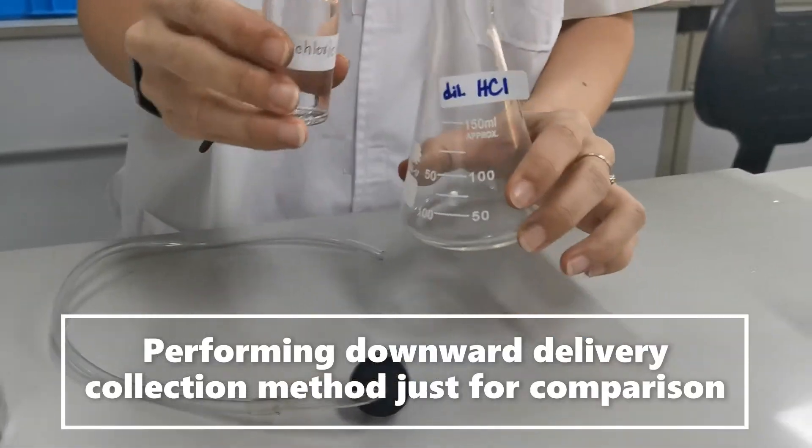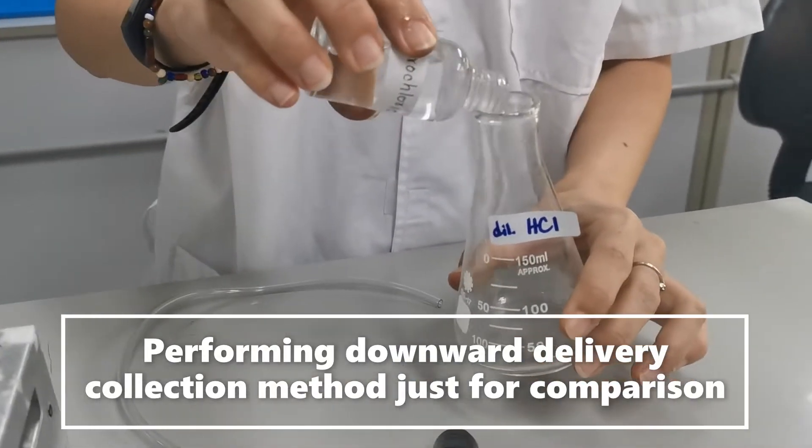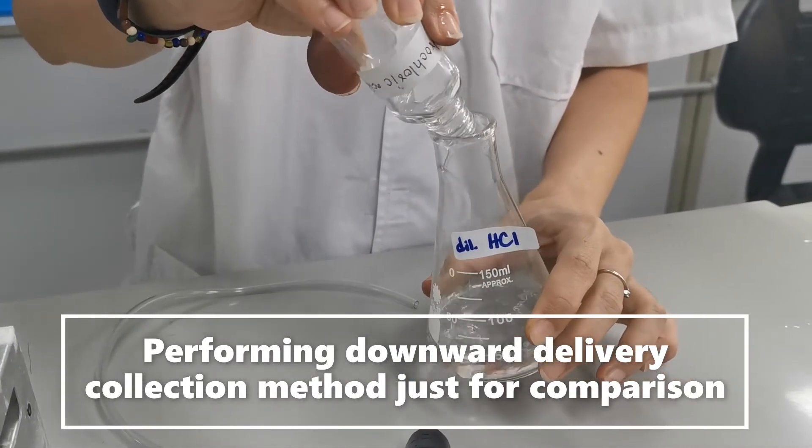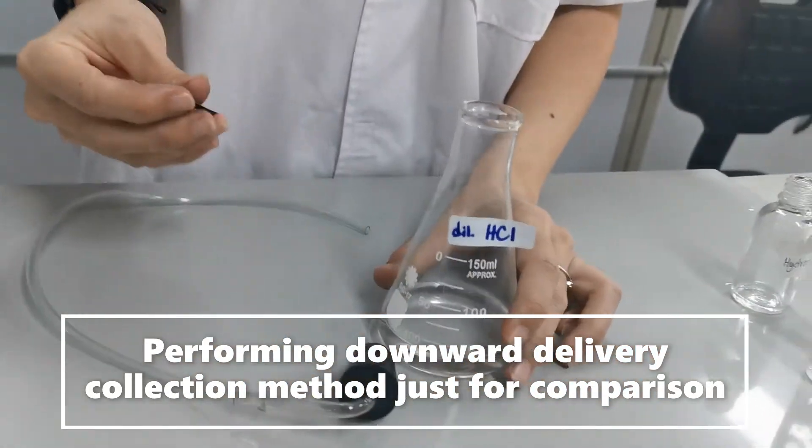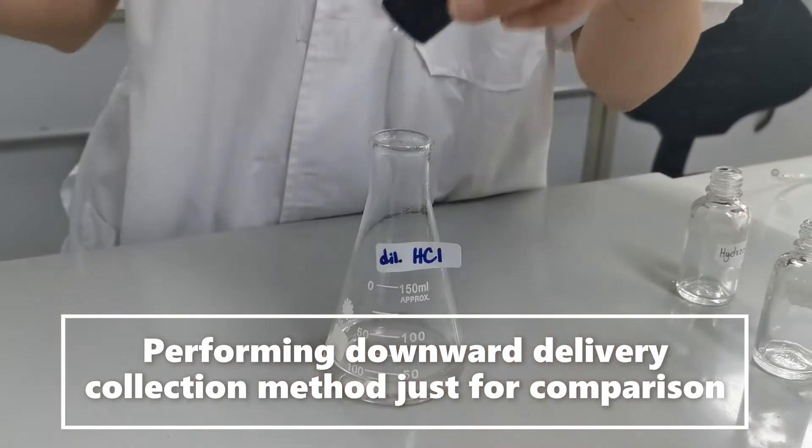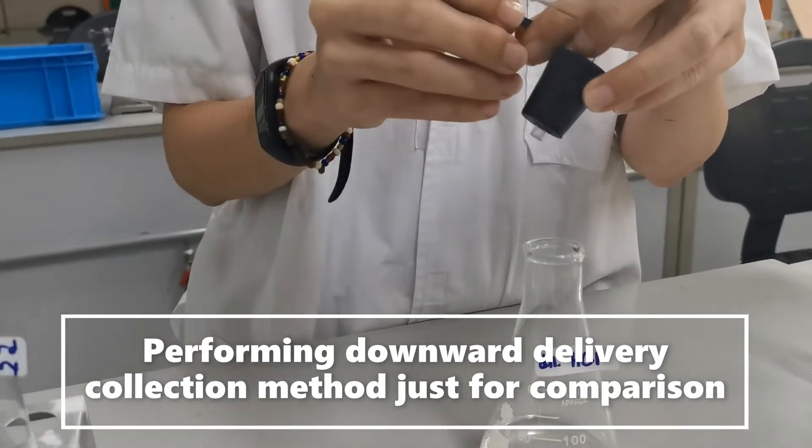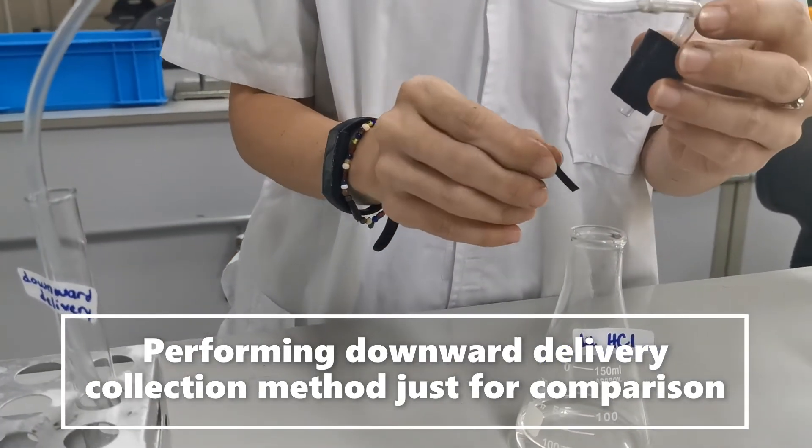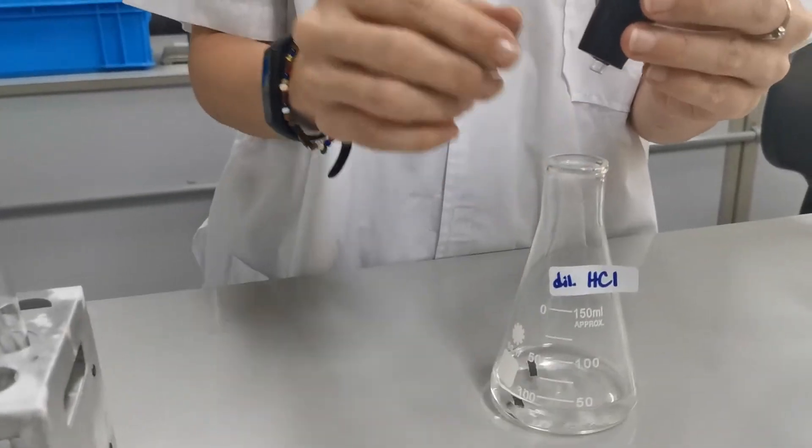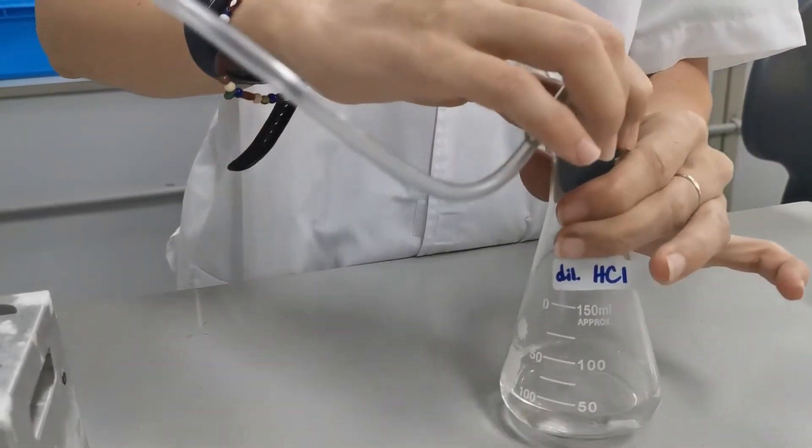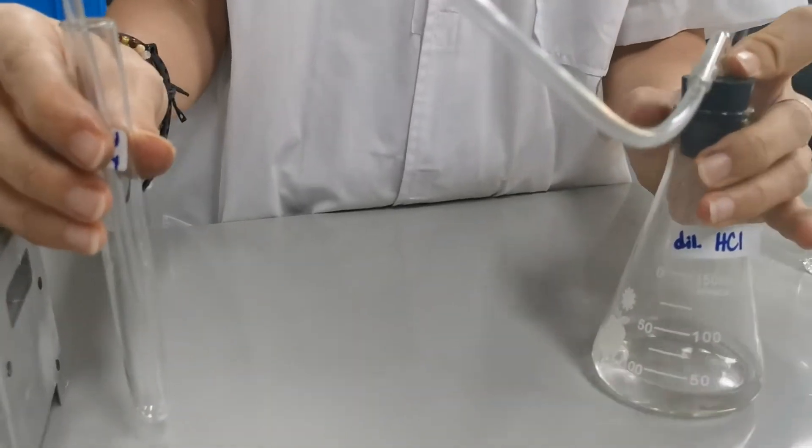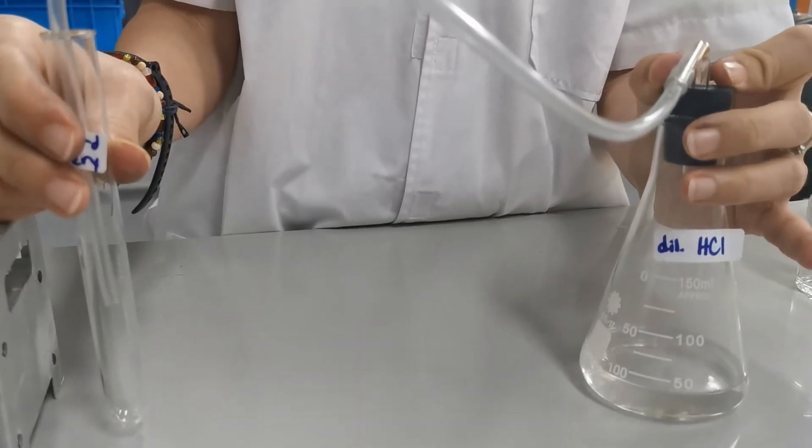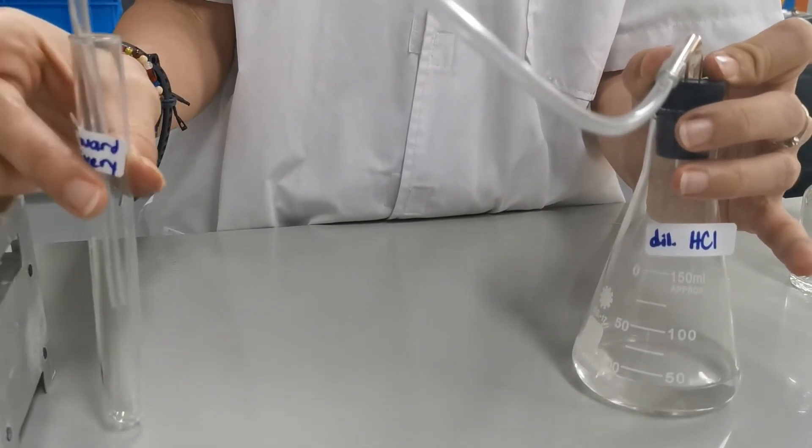I'm going to repeat the same reaction but this time let's collect the gas using downward delivery and we will see how different the gas collected is. Here I'm hoping that the hydrogen gas is going to be delivered into this test tube.